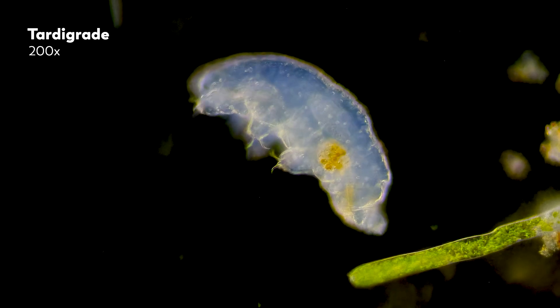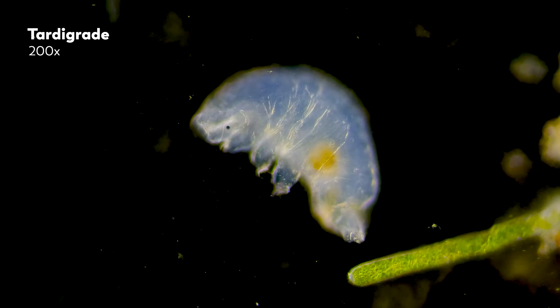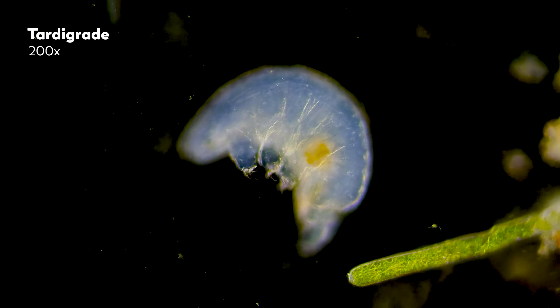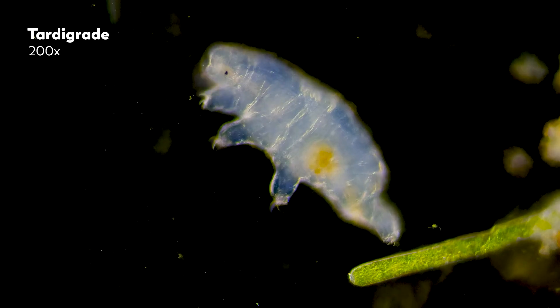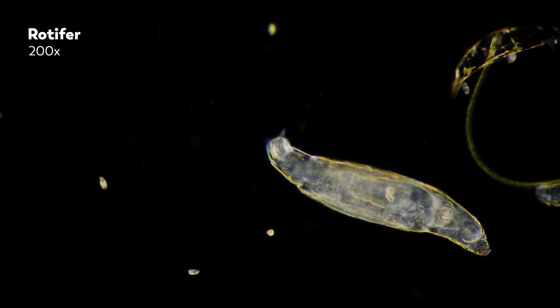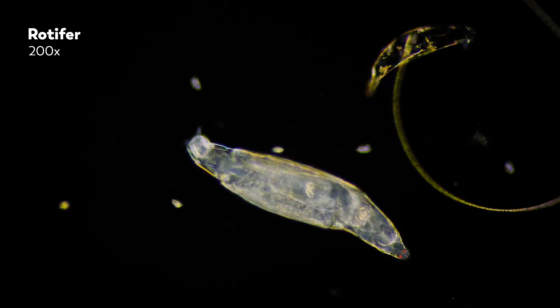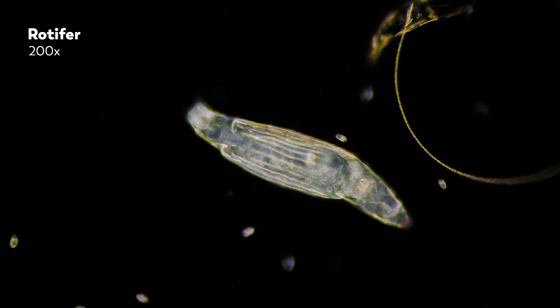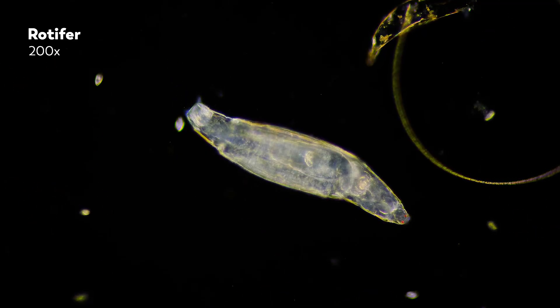There are other ways to contend with this challenge, one of which is built on a simple yet strange property of our world: you don't always need to shine light directly onto an object to see it. This technique is called darkfield microscopy. Light travels from a source through a condenser, goes through the sample, and into the objective lens — but in darkfield microscopy, a circular disk is placed inside the condenser, blocking the central part of the light from shining through the sample and into our eye or camera. When there is no sample on the slide, all you see is black.